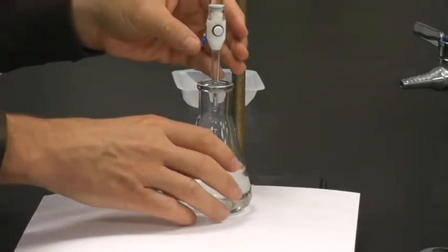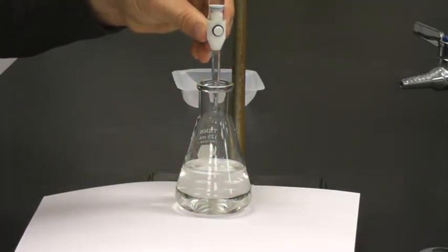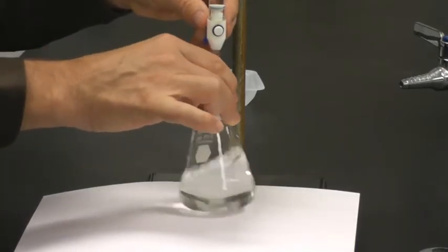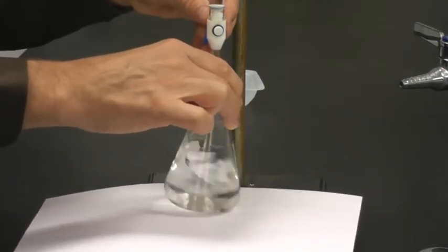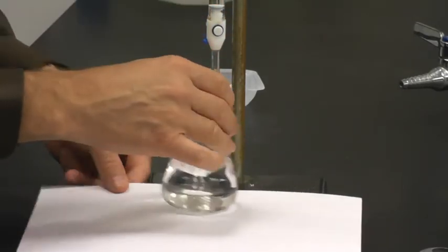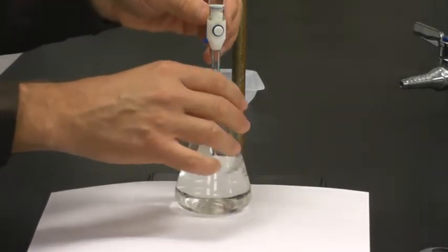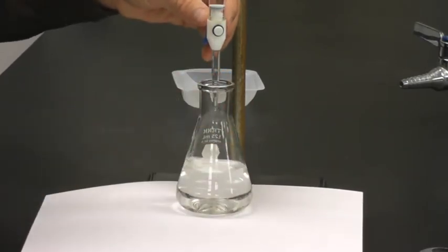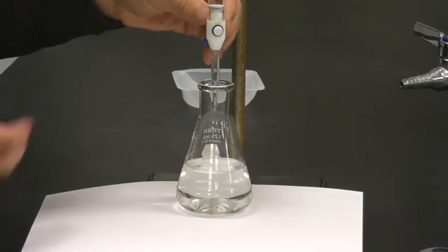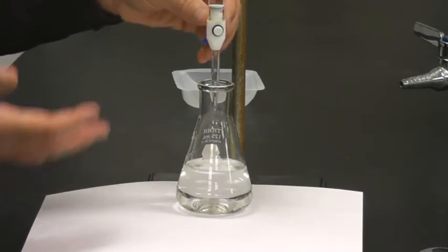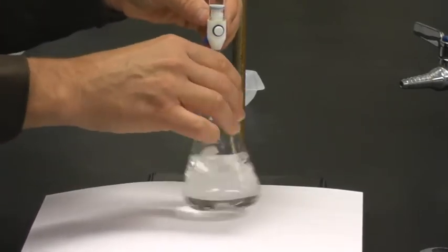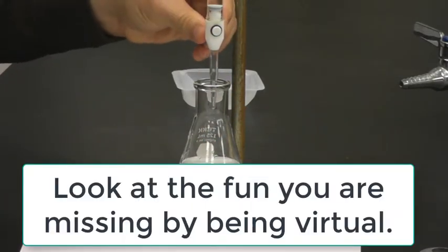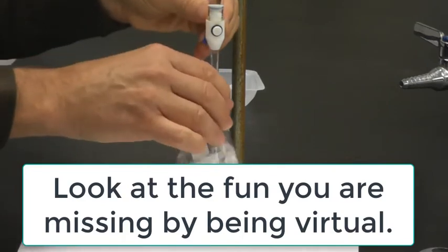So it's kind of persisting a little bit longer. So I'm going to add less and less and less and less. It's nice if you can kind of get just like a steady drip rate. So I don't know if you can see it, but it's kind of like drip, drip. And we just want to get it when it turns pink. Because when it turns pink, it means all of my hydrogen ions from my acid, in this case KHP, are neutralized. And that next drop of sodium hydroxide has extra hydroxide that can't be neutralized, and it reacts with the phenolphthalein and turns it pink. So actually not persisting that much. I'm going to add a little bit faster.